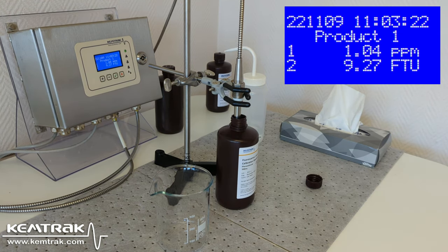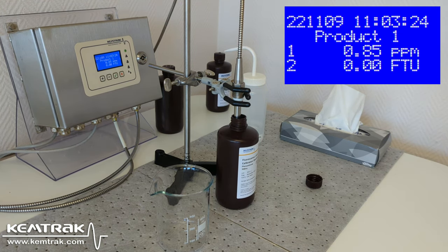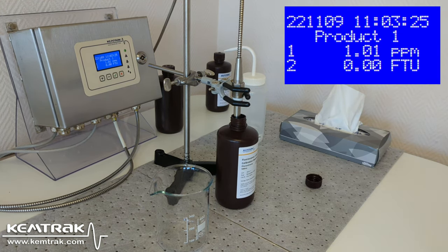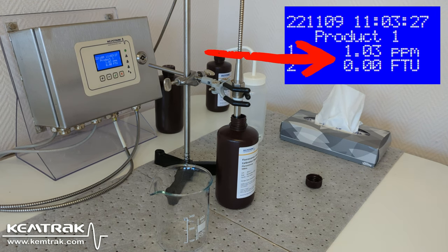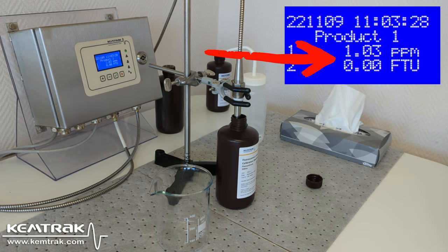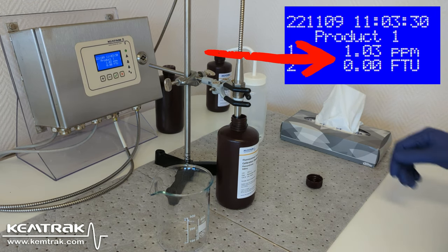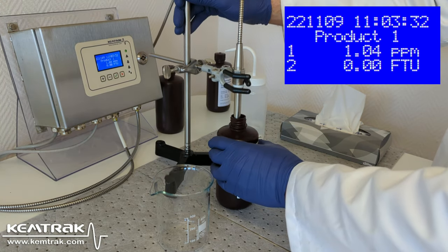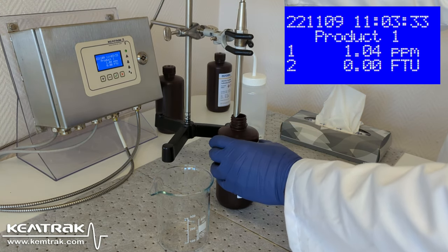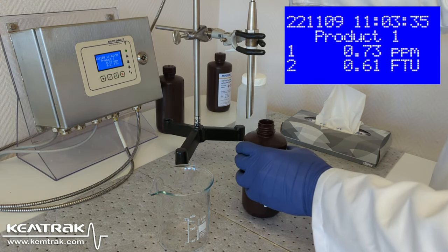The turbidity value is zero because the chemical fluorescence is dissolved. And as you can see, the fluorescence value is at 1 ppm. Then I take out the probe and clean it with ethanol.